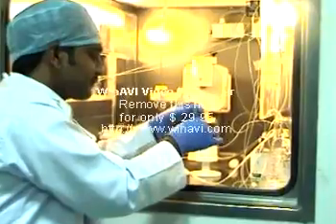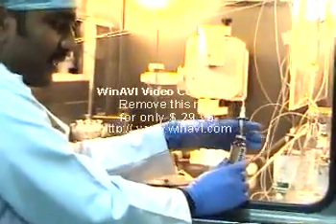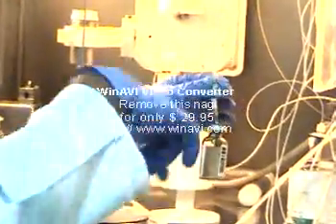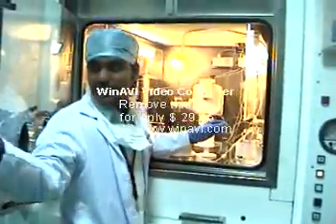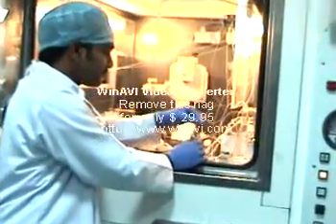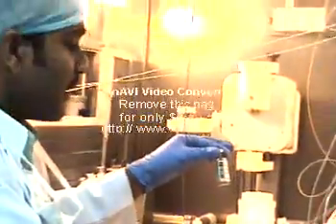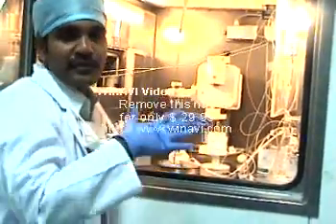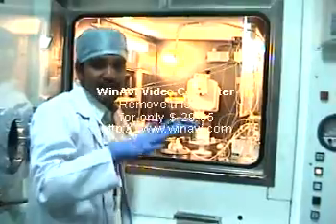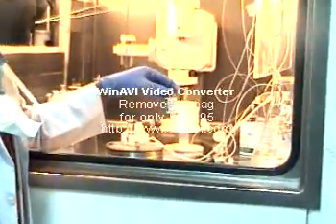Once the fluorodeoxyglucose is collected, we will remove these filters. We handle all of these things using manipulators standing outside the shield. Once collection is over, we will remove the filter and drop this vial into the dose calibrator and measure the activity. Finally, we make a note of that and measure the yield efficiency. Our yield efficiency is nearly 70%. Once we measure the activity, we know how much fluorodeoxyglucose we got.